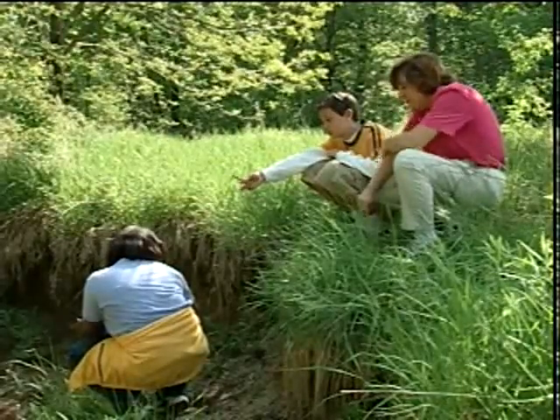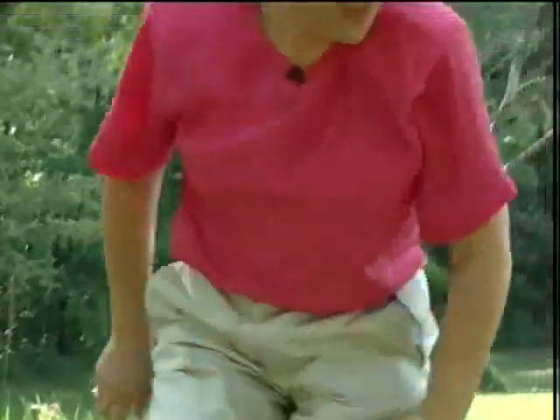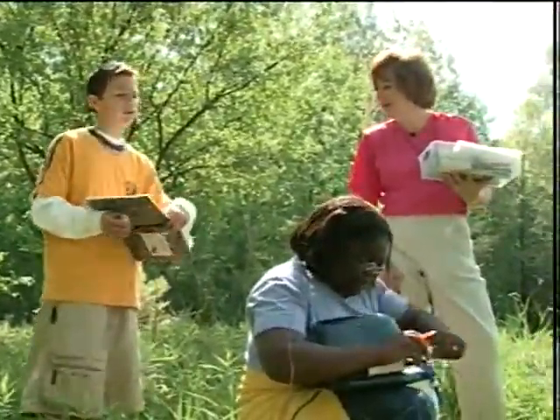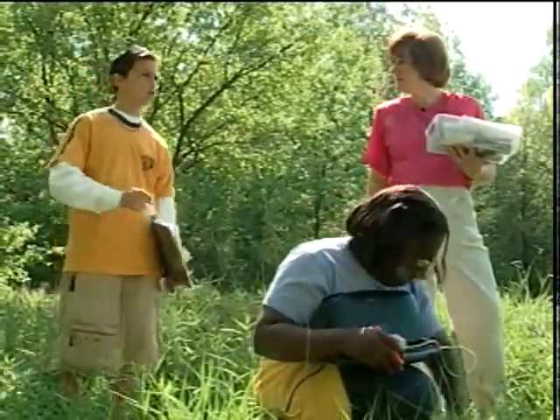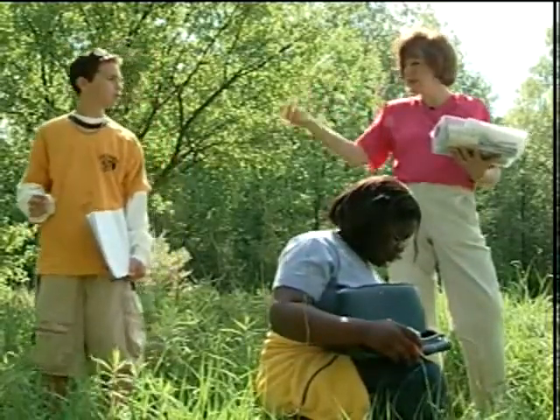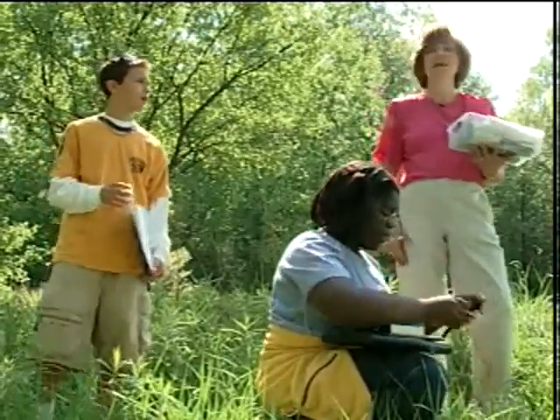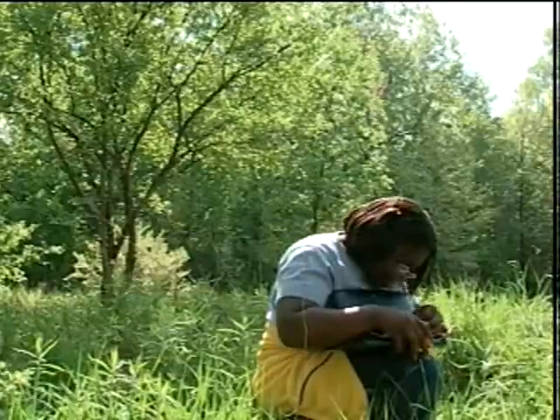What's the ballpark? 570. Ah, that sounds better. Much better. Okay, so about 500 something now? Terrific. My predictions are coming true too. Are they coming true? I predicted it would be a little more constant, but a little bit more neutral, especially farther down because of fertilizer from lawns and stuff. So now you're expecting fertilizer from the lawns to be in here. So what is that going to do to your conductivity? It's going to make it a lot higher. Okay, let's see what we have, all right?